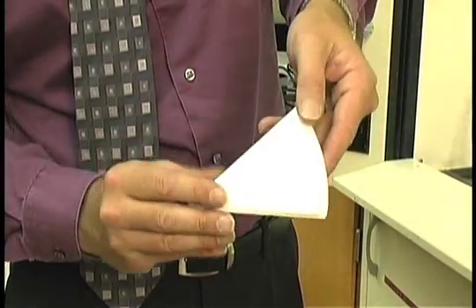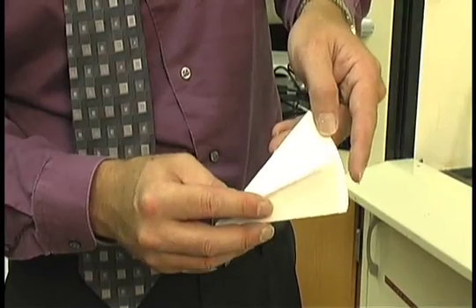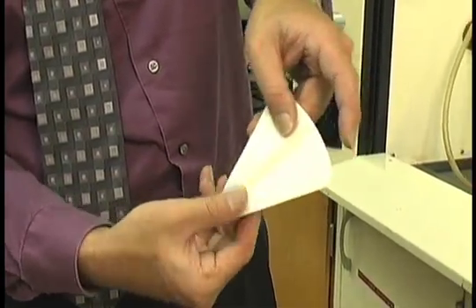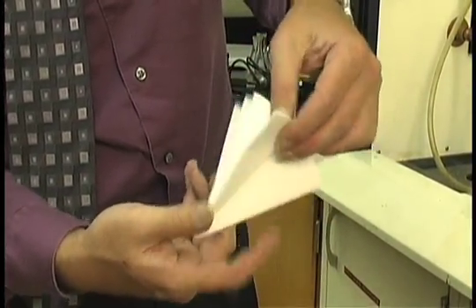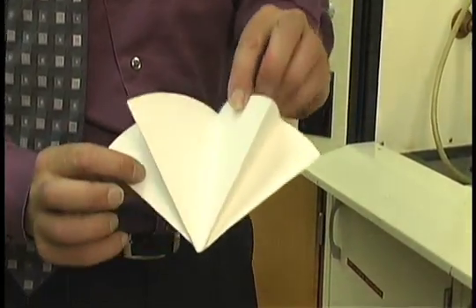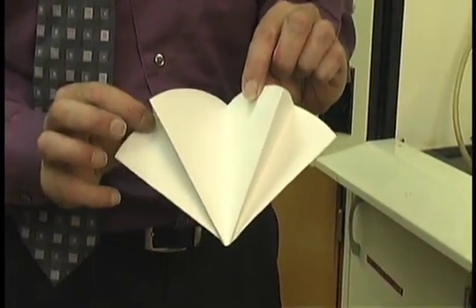Flip the filter paper over and do the same thing again. Take the outer edge, fold it towards the inner edge and crease. Upon opening the filter paper, it should look something of this nature.